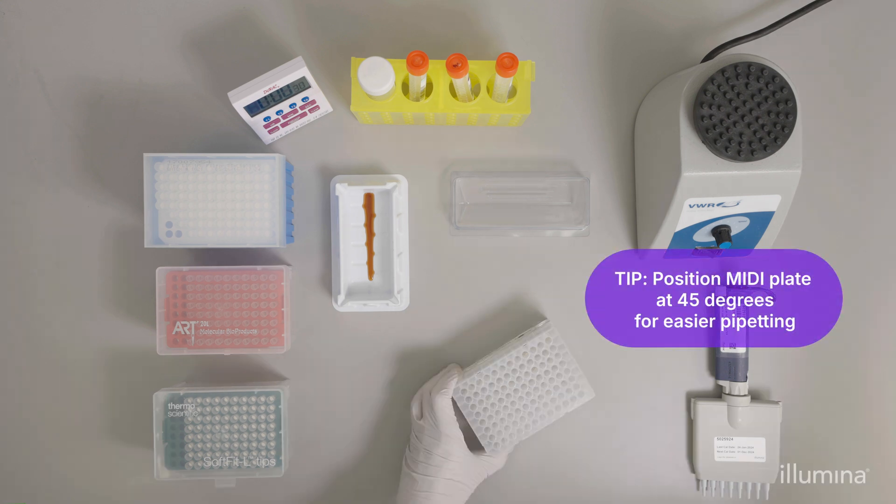Position the plate at a 45 degree angle away from your pipetting hand for better visualization of beads and tips while pipetting into wells.